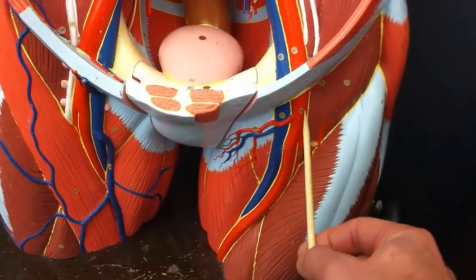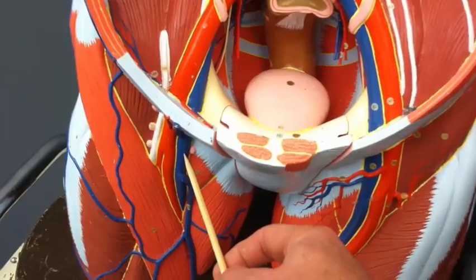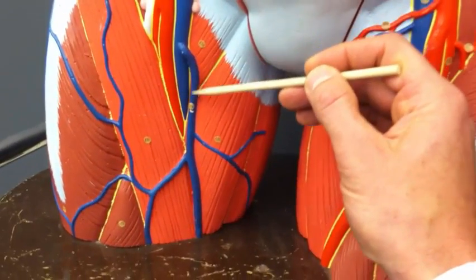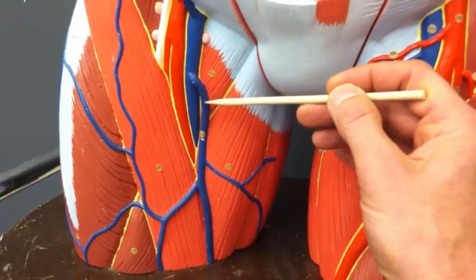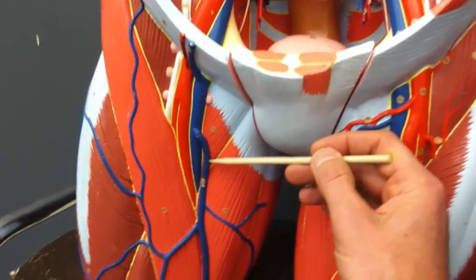And then again down in the legs, we've got femoral vein, femoral artery. These, of course, are on the left, so this is the left femoral artery and the left femoral vein. And then on the right, right femoral vein and right femoral artery. And let's get close here a little bit because we've also got great saphenous over here on this side. Notice that great saphenous coming off of the left femoral vein. So this is great saphenous vein. In fact, it's right great saphenous vein.